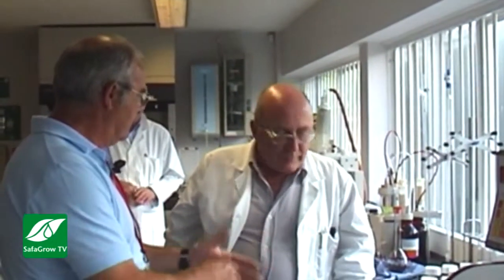We're all used to batch numbers. It says so on the box. When my spray operator undoes the box, there's always a batch number on there. How long do you have to keep a sample here in the lab to keep going back to? And do you keep any paperwork regarding that sample? Ideally, we keep samples for 3 years, because the shelf life of pesticides or whatever we make is usually guaranteed for 2. But we will keep one for 3 years just in case a farmer finds a can at the back of his shed. They are kept because of the possibility of complaints.